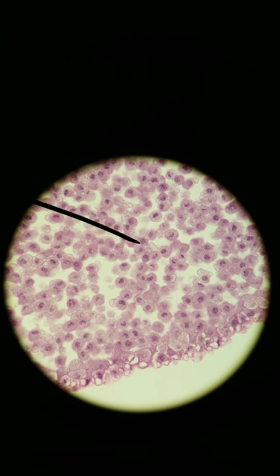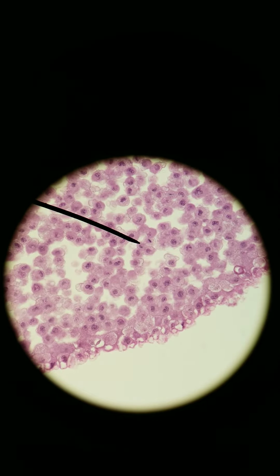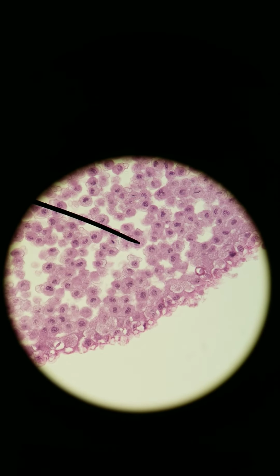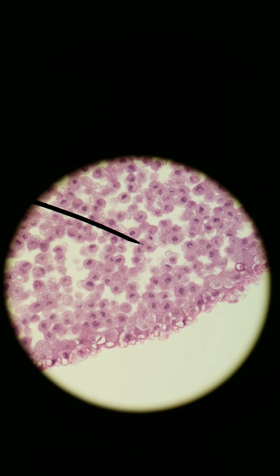While I'm here, since we can't find a really good example of anaphase, in this one here the chromosomes have already separated, but we still have one cell, though it looks like two. You see that pinching in right there? That pinching in, the process is called cytokinesis. Cytokinesis happens during the last phase of mitosis. This is telophase. So this one here, you can see this splitting cell and the one attached to it right here. This is a cell in telophase. It's about to split in two.